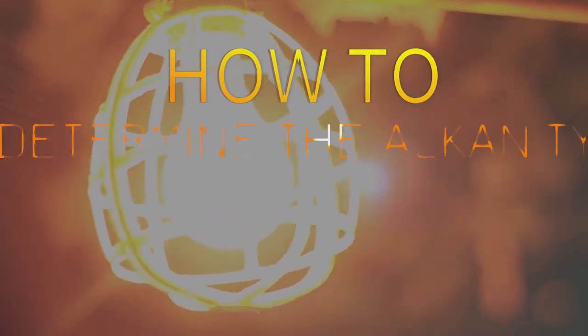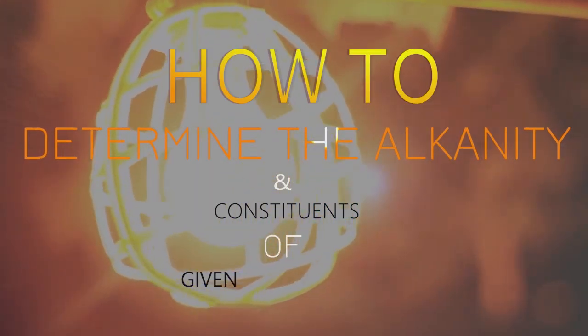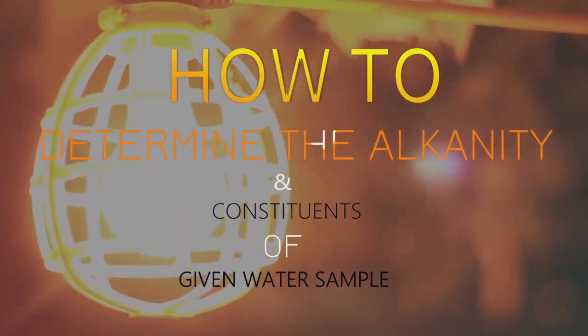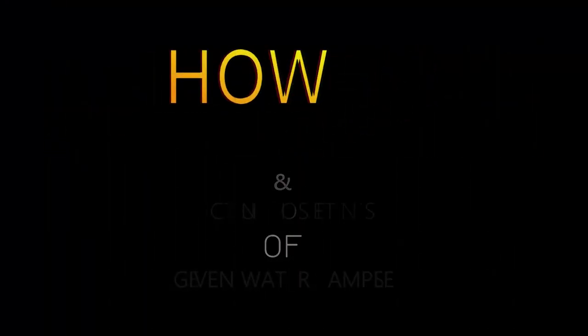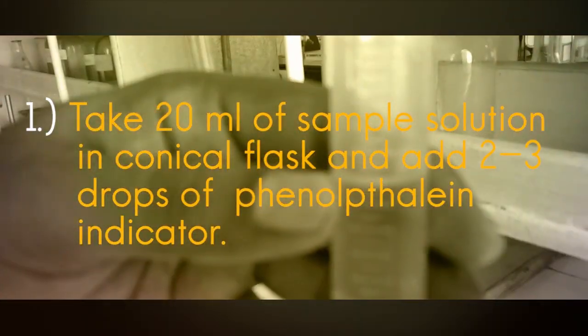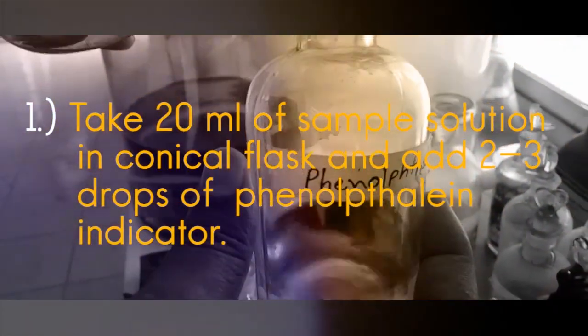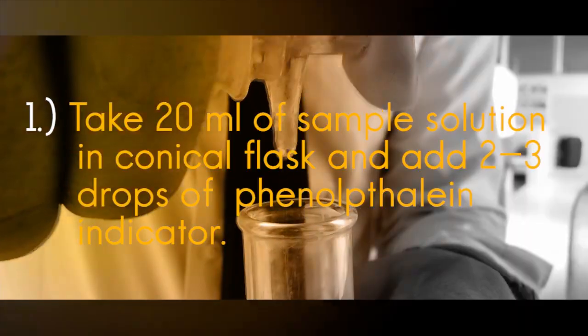In this video, you will learn how to determine the alkalinity and constituents of given water sample. We will be following 4 steps, and these are: Number 1. Take 20 ml of sample solution in conical flask and add 2-3 drops of phenolphthalein indicator.